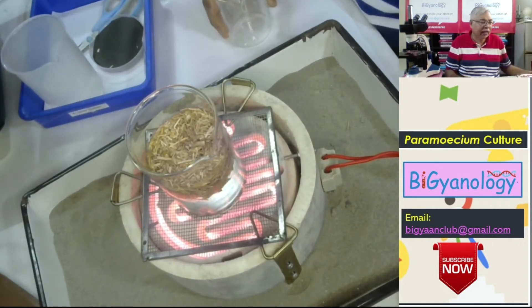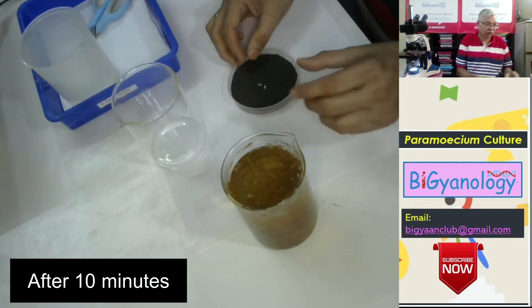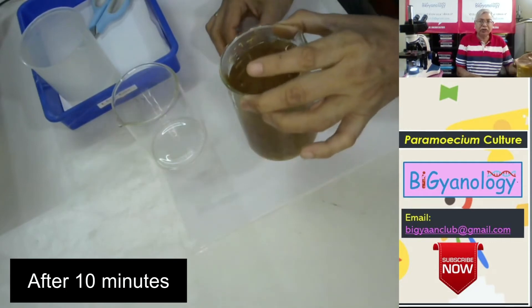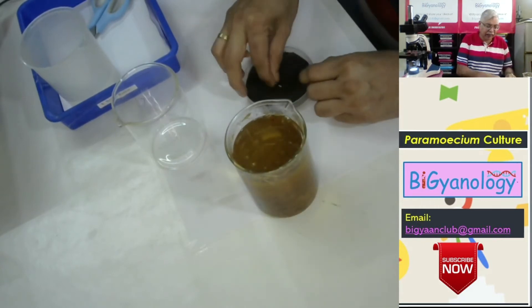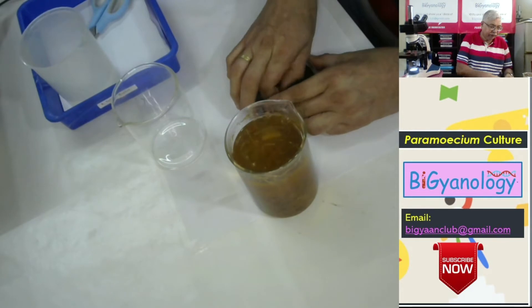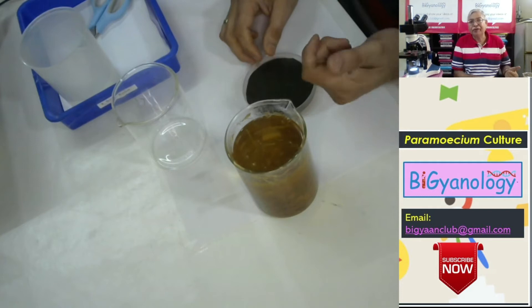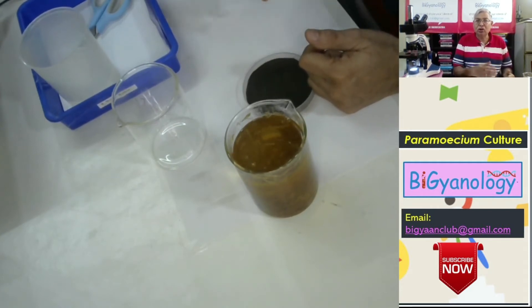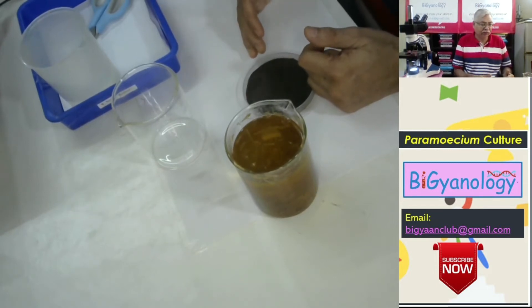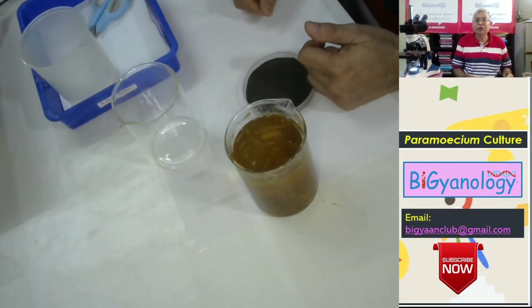It will take about 10 minutes time to be heated. This is nearly cooked. And just before you take it down from the heat, you should add two specks of rice, so the rice becomes half cooked. The advantage is the starch in the rice slowly becomes soluble, and so you can easily get the starchy substance inside, which is food for the paramecium.